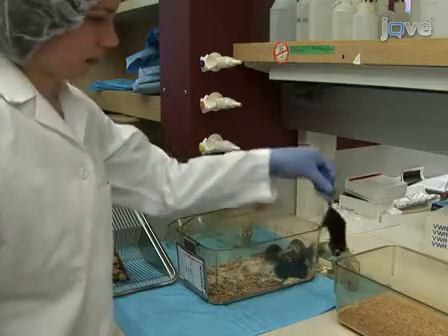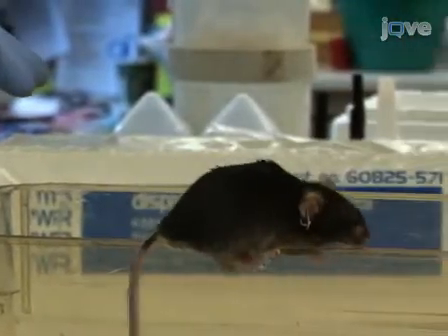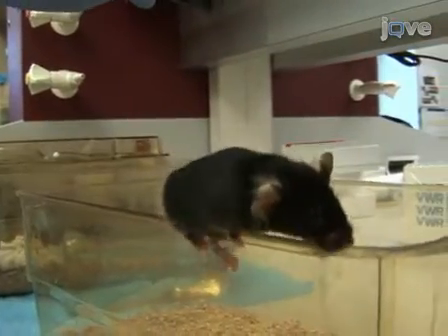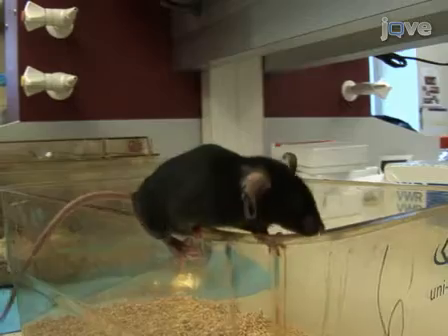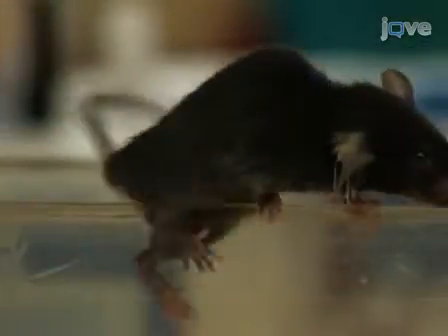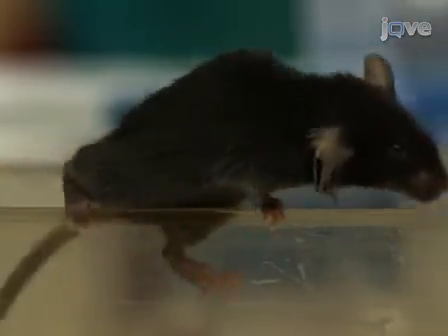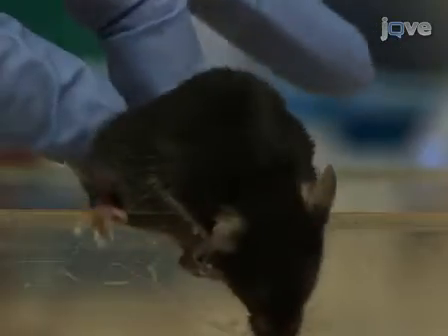If the mouse loses its footing while walking along the ledge but otherwise appears coordinated, it receives a score of 1. If it does not effectively use its hind legs, or cannot gracefully lower itself into the cage, it receives a score of 2. If it falls off the ledge, or nearly so, while walking or attempting to lower itself, or shakes and refuses to move at all despite encouragement, it receives a score of 3.